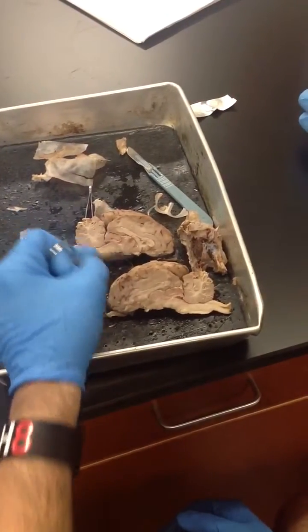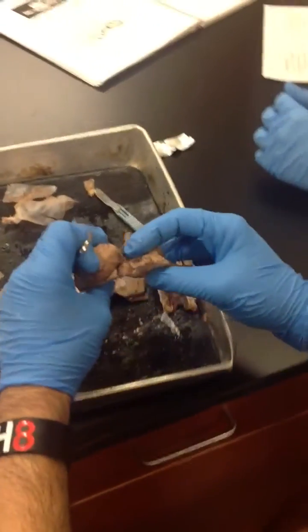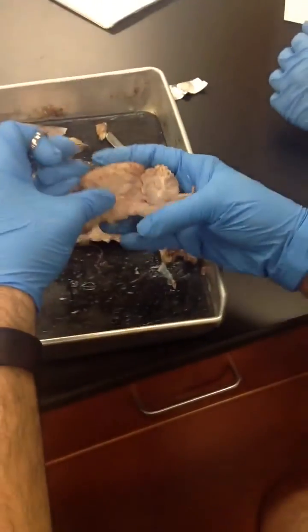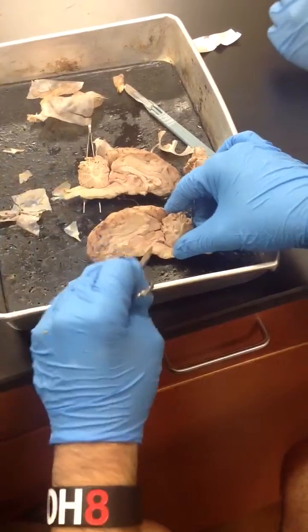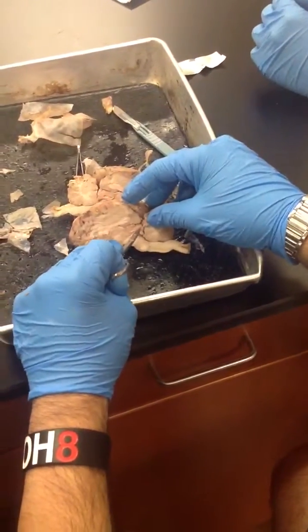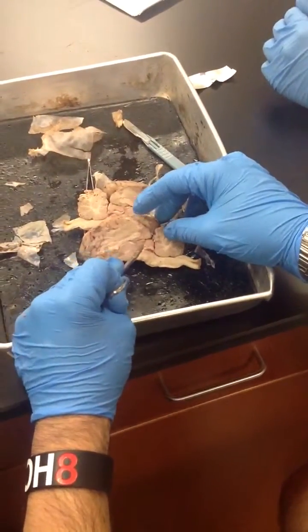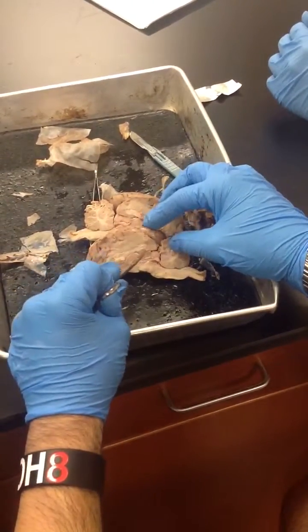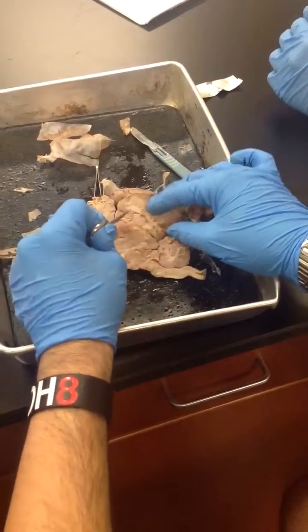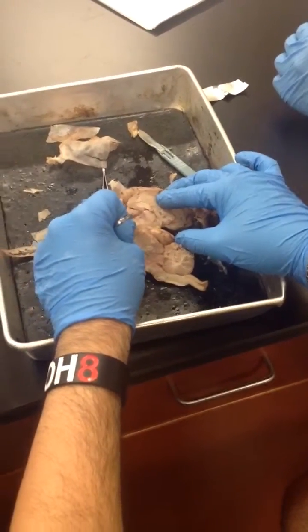Then you have the superior and inferior colliculus from the outside, right there, that you would need to identify from the inside. So superior here, inferior here. Superior, inferior colliculi. And then on top of the superior, you have this round structure here, which is the pineal body or the pineal gland. And you have it on this side kind of too. It's like right there.